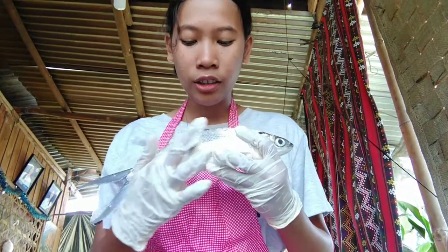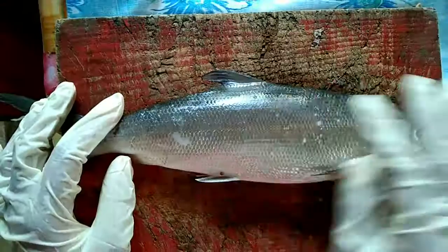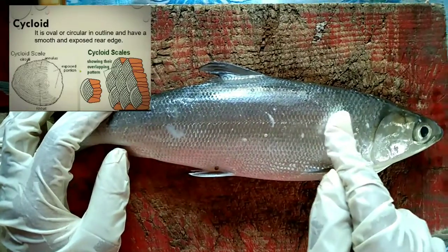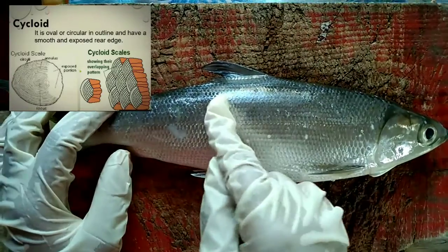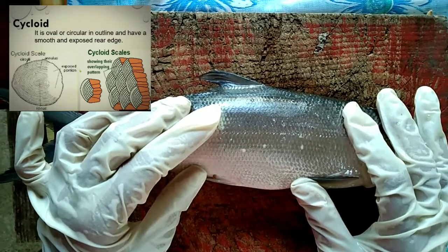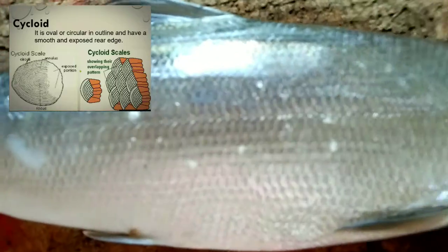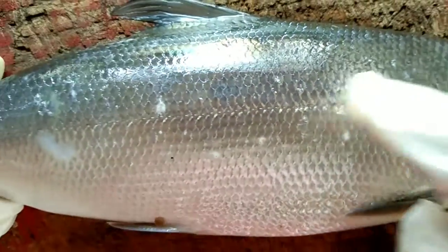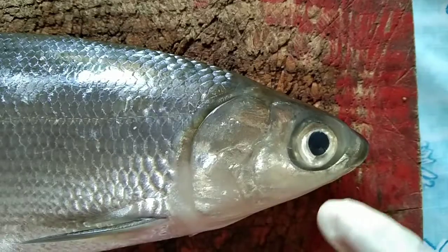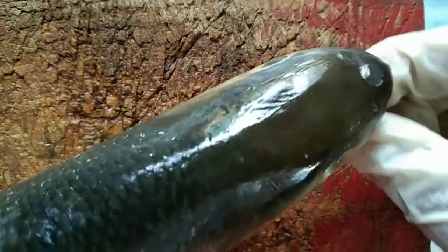This part is the scales of the fish. This fish has cycloid scales. Cycloid scales are oval or circular in outline, and have a smooth and exposed rear edge. Also, fish scales tell the age of the fish.